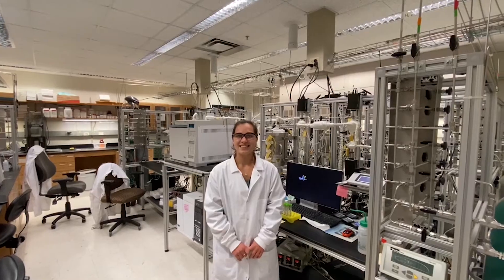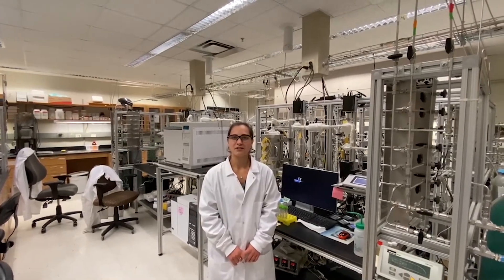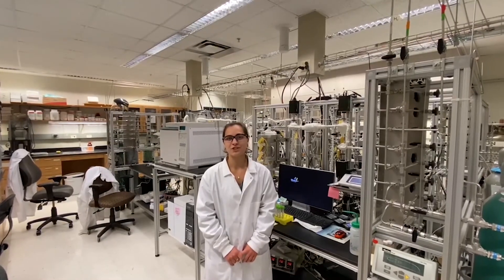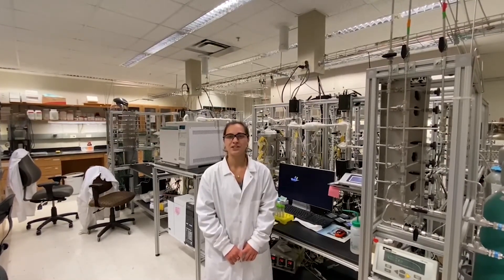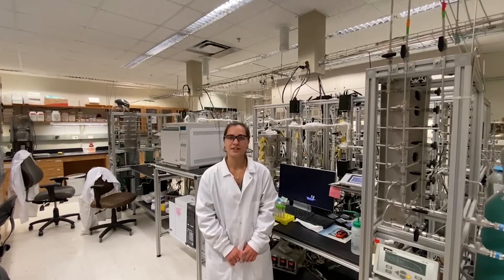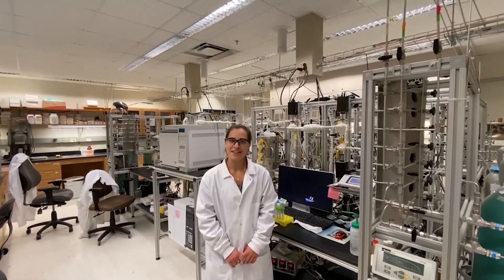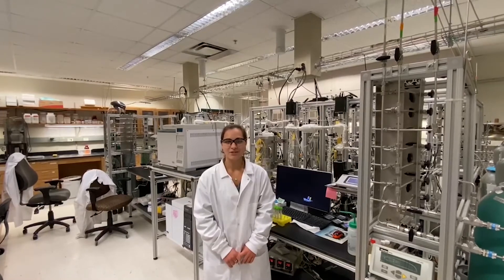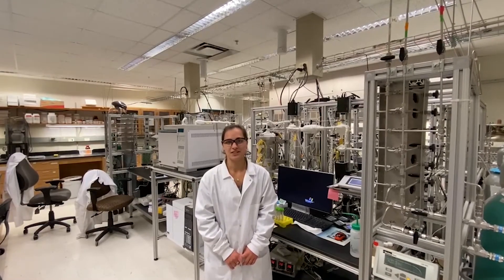In this lab, we have five custom-built flow reactors that were built by the first graduate students to join each of the projects. They're used for a range of projects including methanol dehydration, partial methane oxidation, ethylene dimerization, and olefin oligomerization.